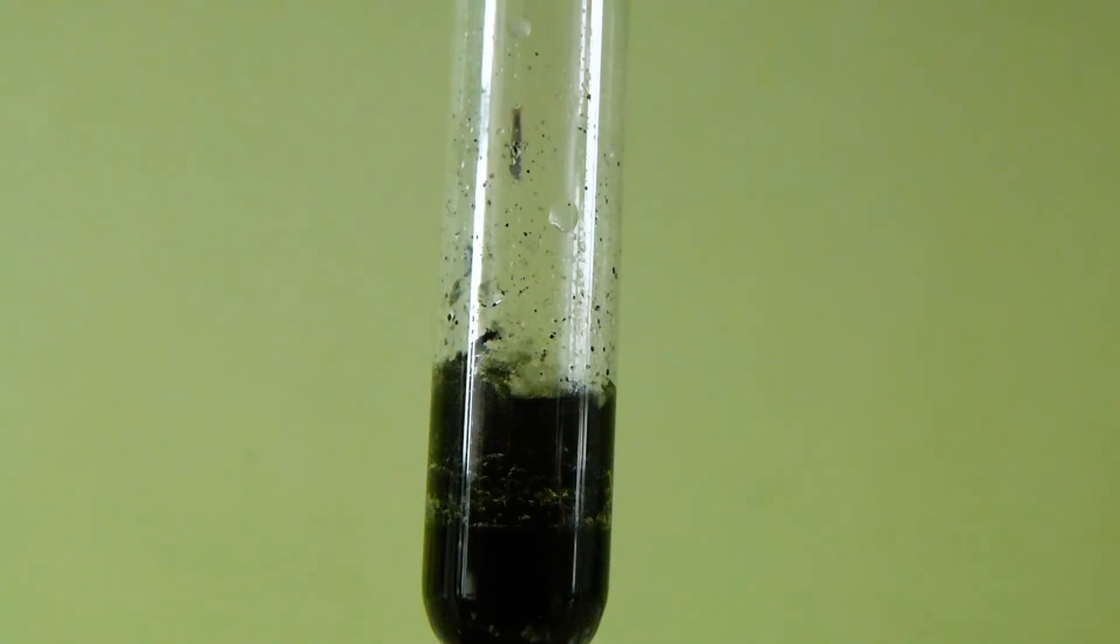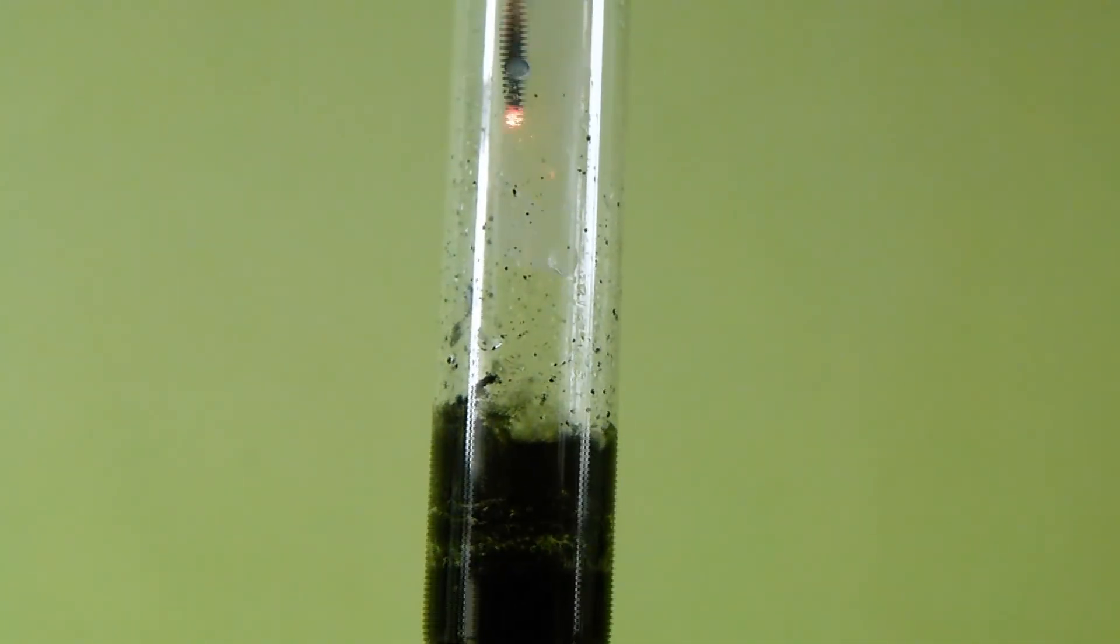Immediately oxygen is evolved, and inserting a burning splinter it looks like it is not extinguished, which is actually quite enough evidence for me that we indeed made calcium peroxide.